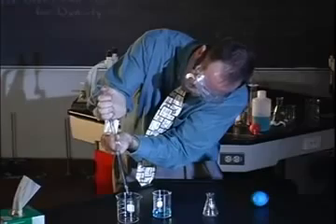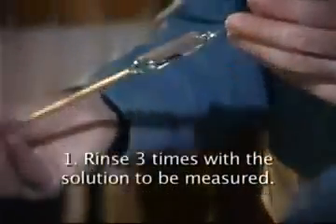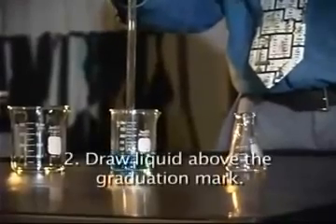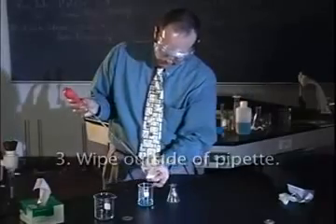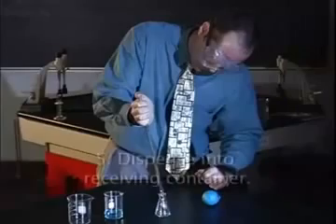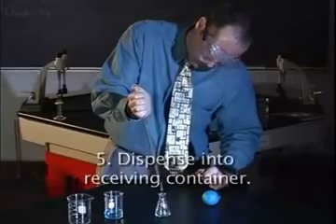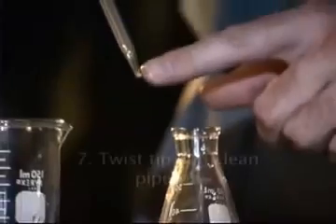Let us review the steps for proper use of a pipette. Rinse 3 times with the solution to be measured. Draw liquid above the graduation mark. Wipe outside of the pipette. Drain to the graduation mark. Dispense into the receiving container. Wait 15 seconds. Twist tip and clean pipette.